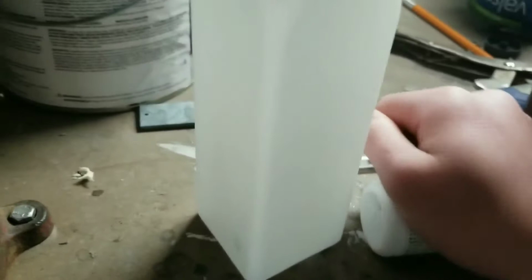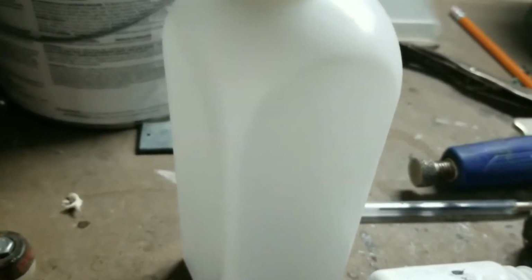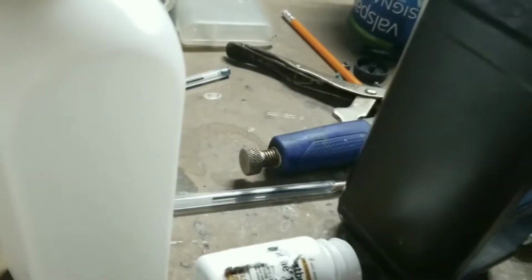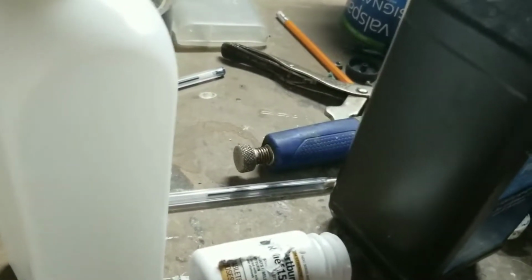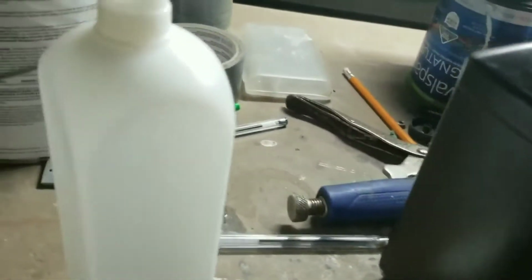And third, the products that electrolysis rig created were contaminated since it had an open top and was able to leak in gas, and it also leaked out fluid. So I decided to go for a different electrolysis rig approach.